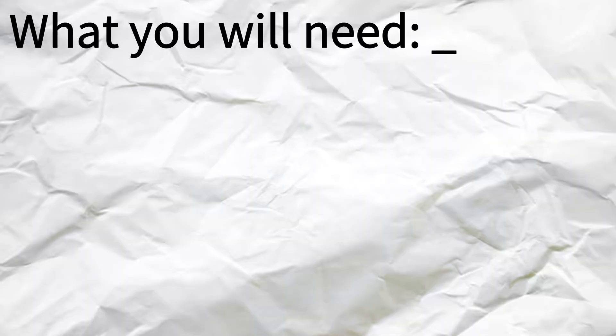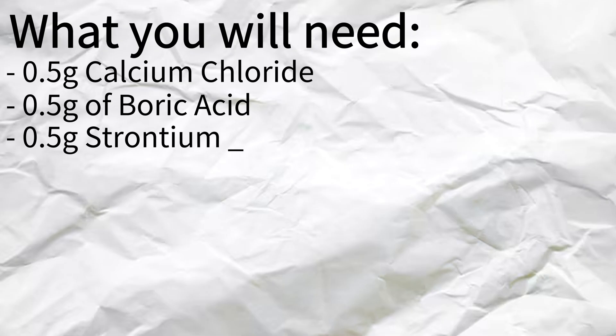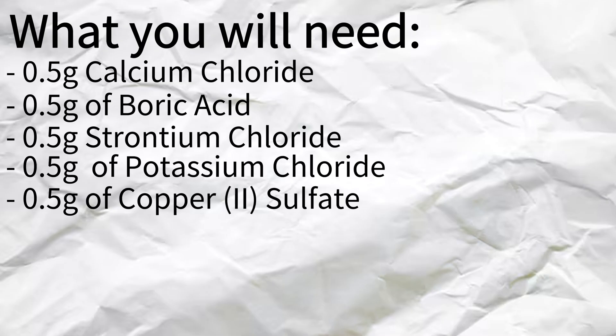The experiment is pretty simple. We'll be using around 0.5 grams of a few different chemicals, each of them having a different colored flame. We'll be using a few common salts like calcium chloride, boric acid, strontium chloride, potassium chloride, copper-2 sulfate, and lithium chloride.